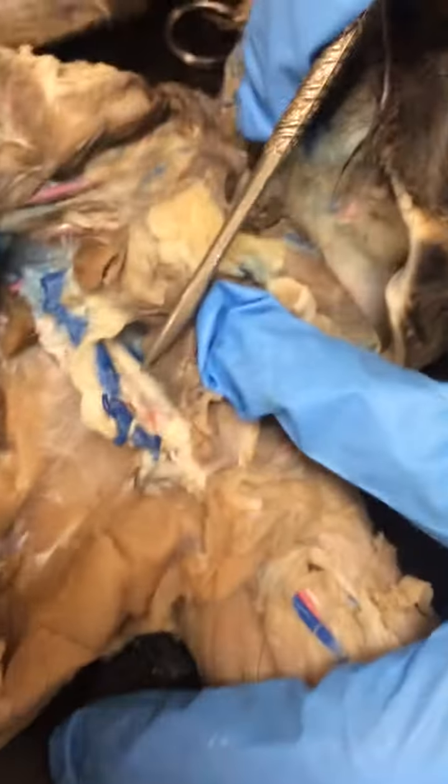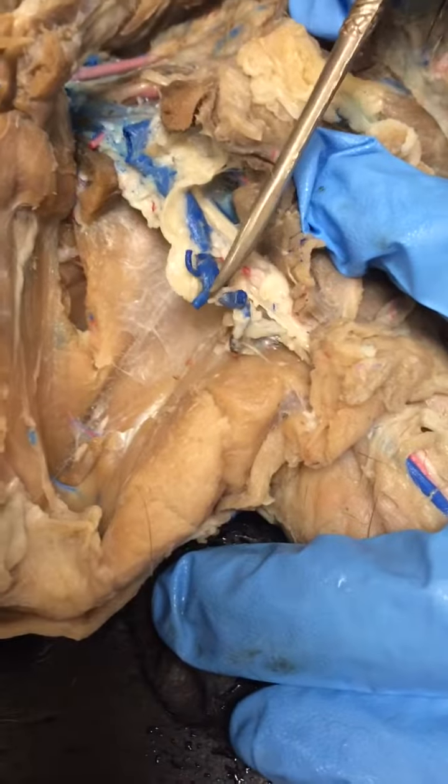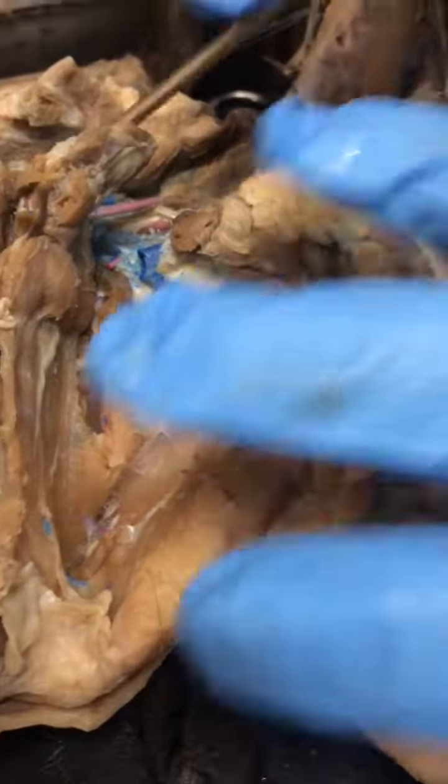It becomes axillary at the armpit. You can kind of see where it breaks out, right? See here where it forks in the vein. That's going to be where it turns into the axillary vein and axillary artery. It's just that our cat's kind of messed up in that region.